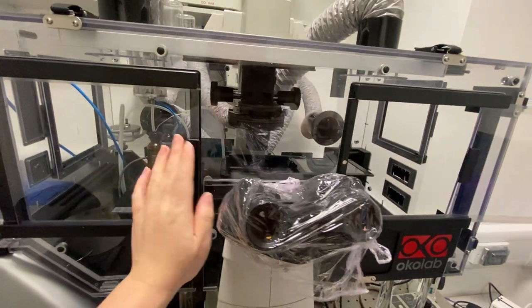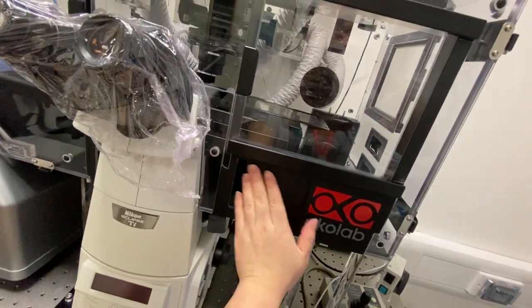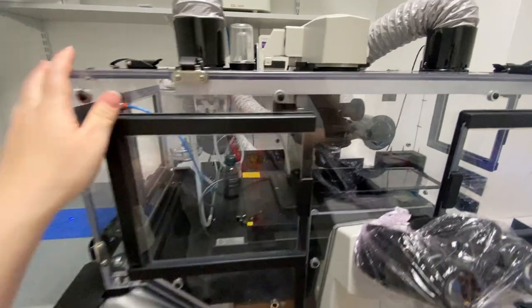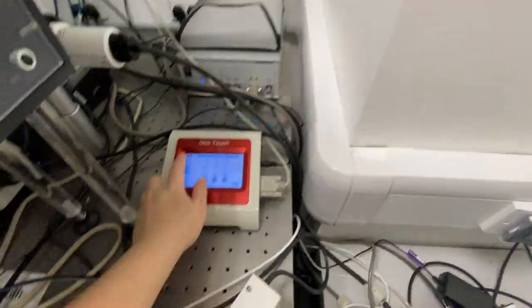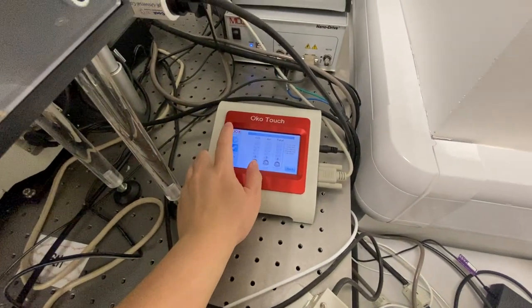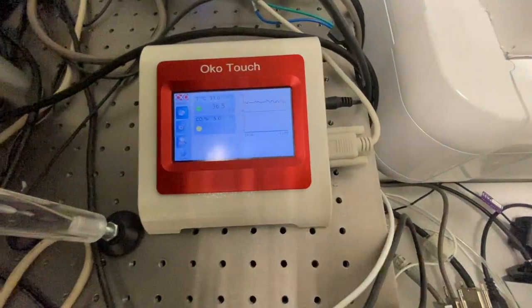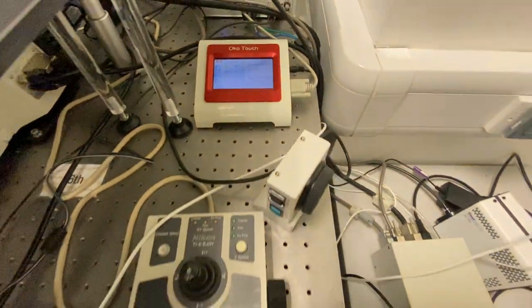Try to keep all the doors closed on this incubation box because the iSIM is constantly at 37 degrees. So we keep it at 37 degrees at all times.